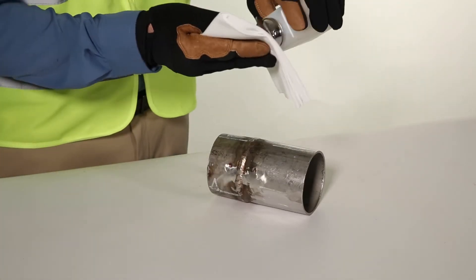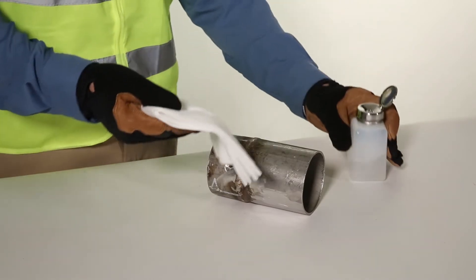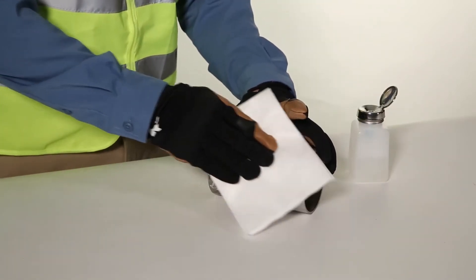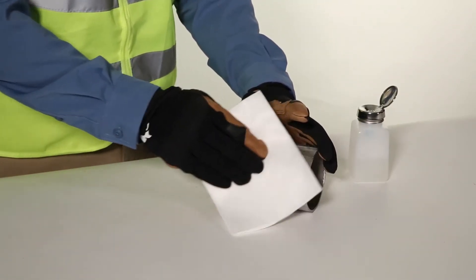Before grinding, clean the area to remove oil, grease, or debris using a basic cleaning solvent such as isopropyl alcohol or acetone.